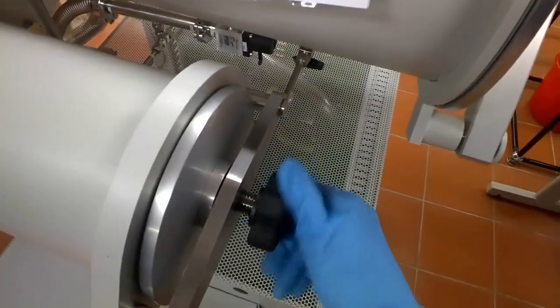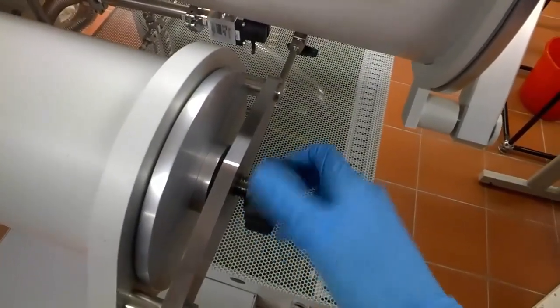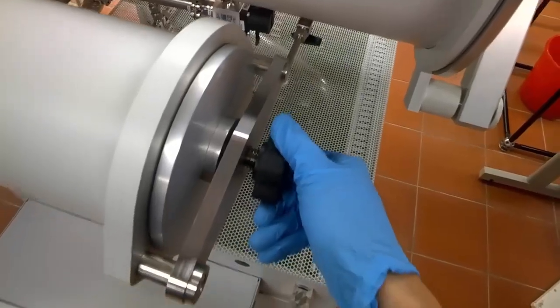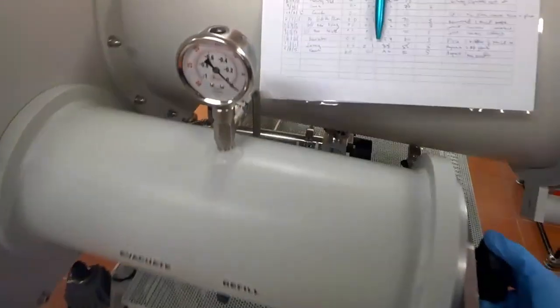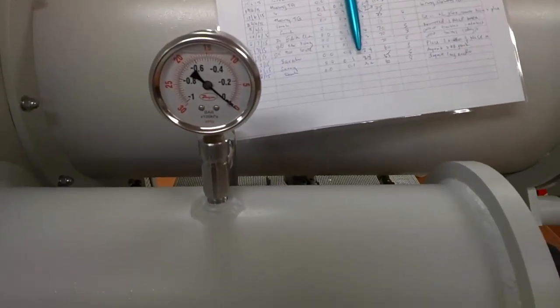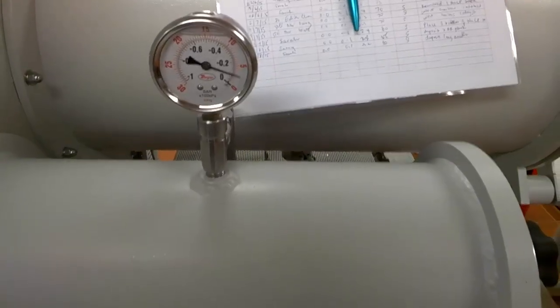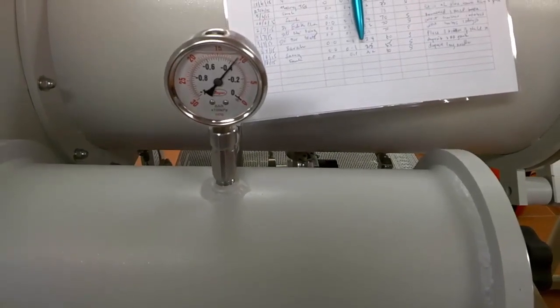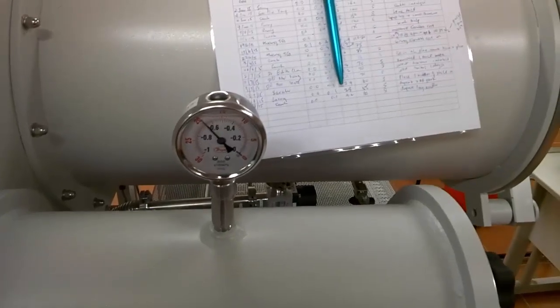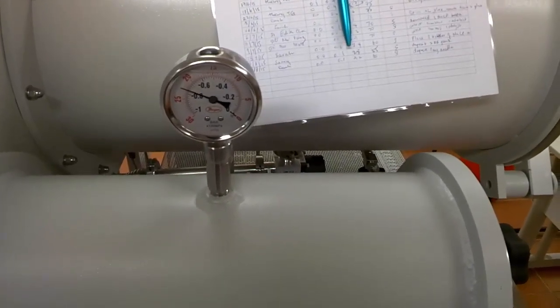Again, gentle. And turn the knob. Screw it. Not too tight. Just finger tight. What do we do now? We evacuate. Because just now, the antechamber was exposed to air. So now we are going to evacuate. And then put the nitrogen. And do that again three times.